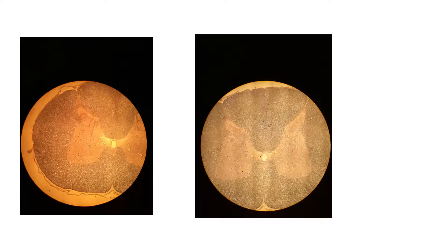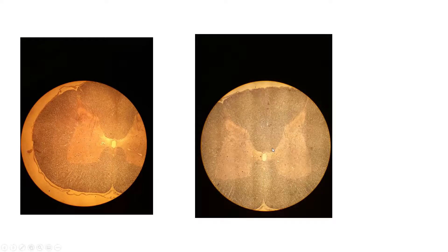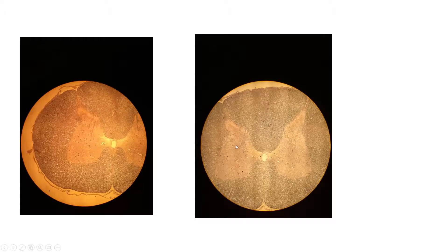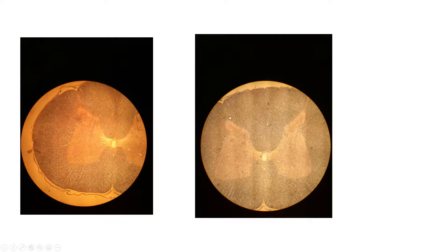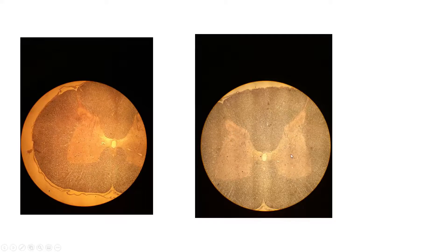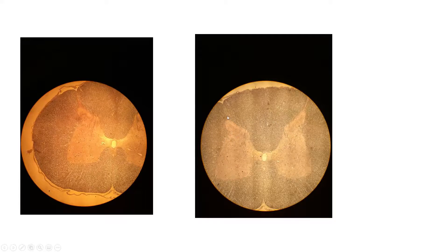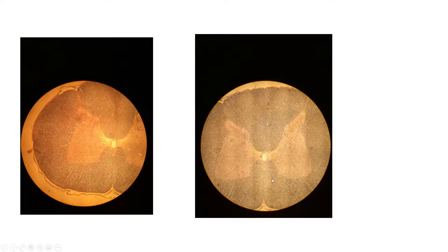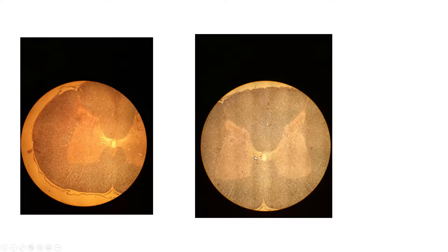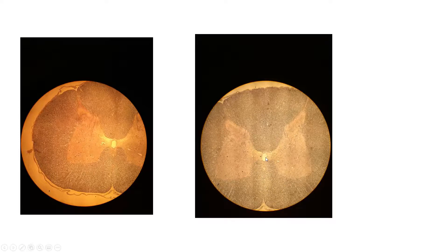Moving on to the spinal cord, here's a microscope slide of the gray and white matter of the spinal cord. You can see the different horns that we talked about and funiculi — posterior back here, anterior up here. You've got your gray commissure here with the central canal.